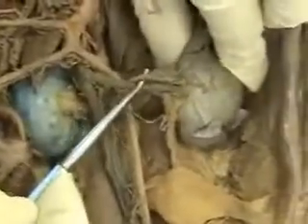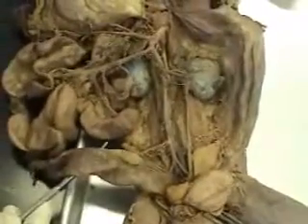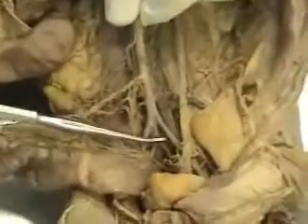There are other arteries branching off the abdominal aorta. Here, this is the renal artery branching off the abdominal aorta right here that goes to the kidneys. But in terms of the third artery supplying the digestive tract, it's this one right here, the inferior mesenteric artery going to the large intestine, the colon. So in a kind of wide-angle view, celiac artery to the upper part of the abdominal organs, the superior mesenteric artery to the small intestine, the inferior mesenteric artery supplying the large intestine. At the bottom of the abdominal aorta, it terminates by bifurcating or dividing into a right and left iliac artery.